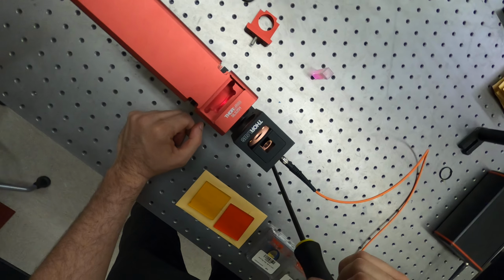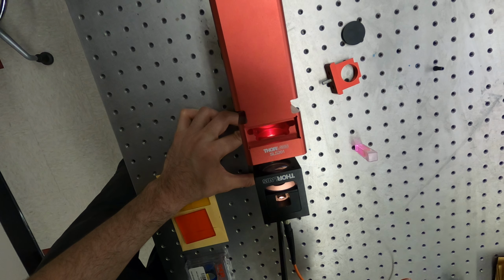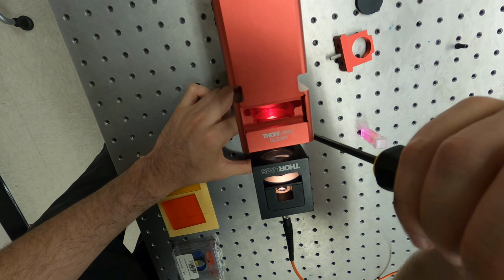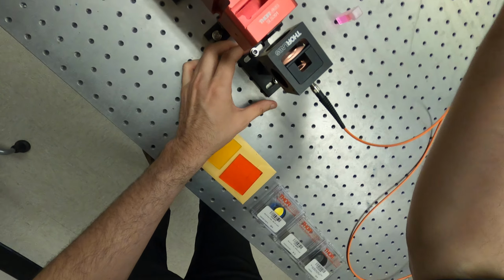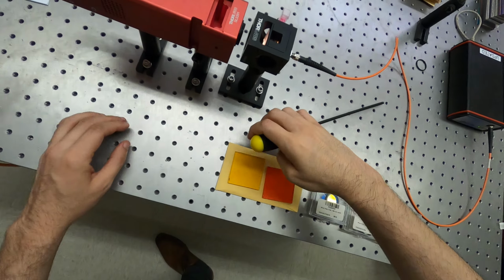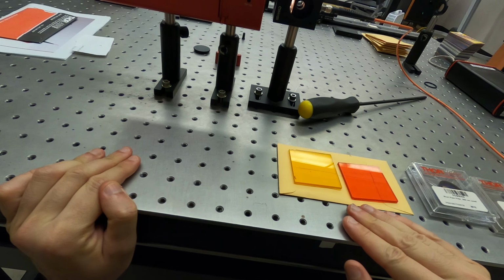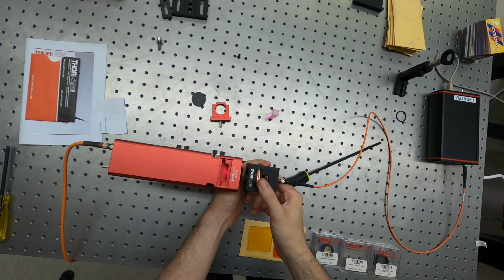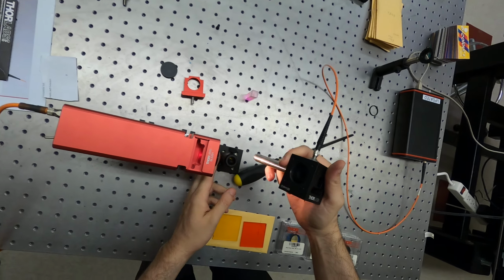We'll check the height if this is aligned. I need to move a little bit to the right. And you can check the height. Okay, the height is okay. And we rotate this by 90 degrees.